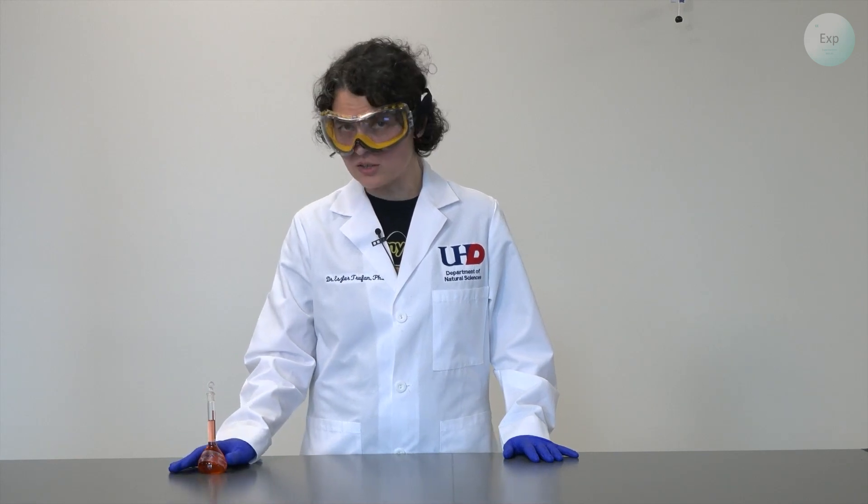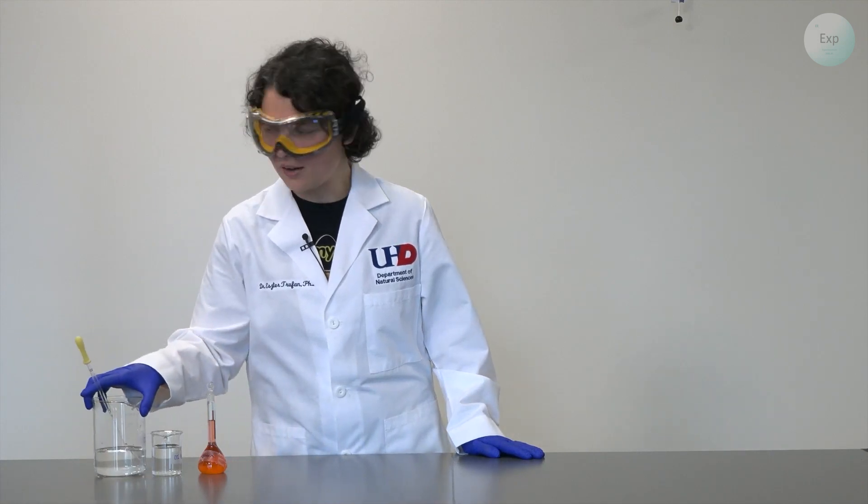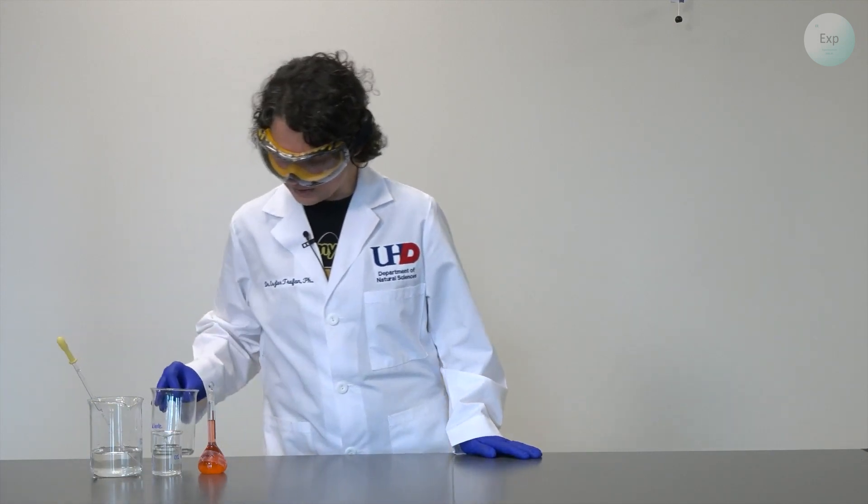So starting with our stock solution and some deionized water, and in this case, I have a little bit more of it here, including a waste container.